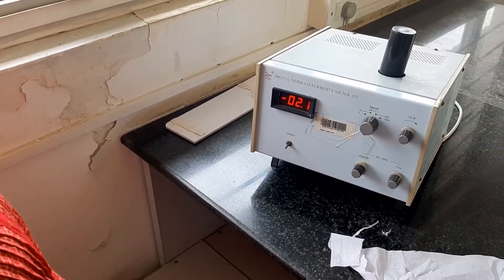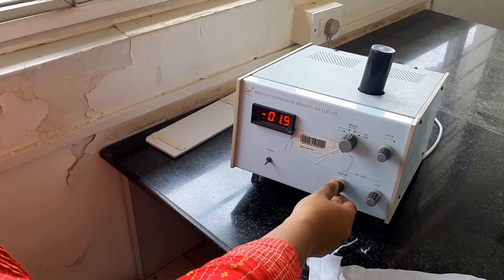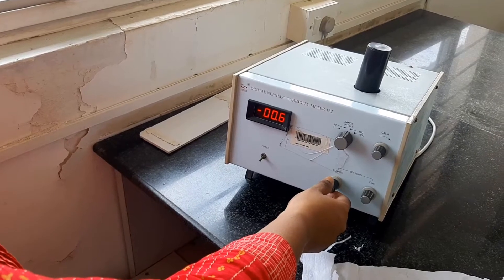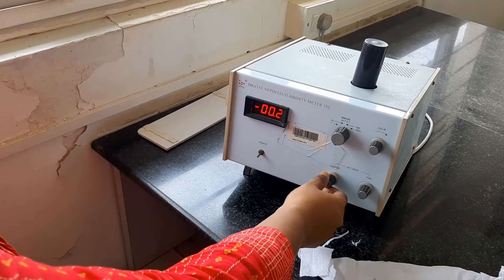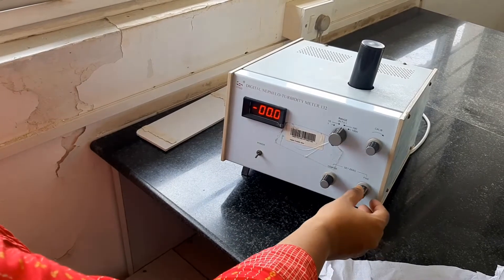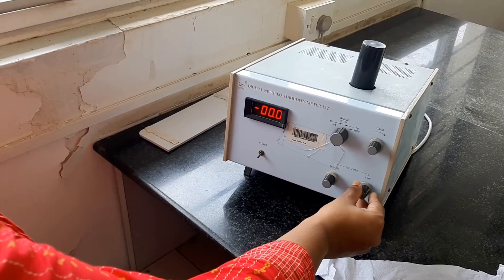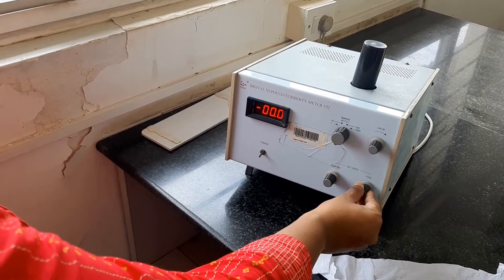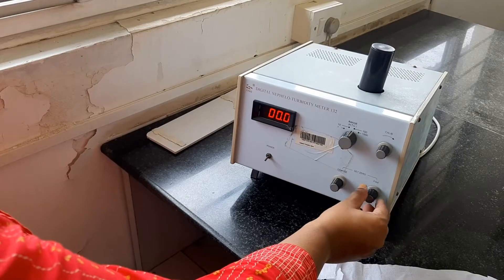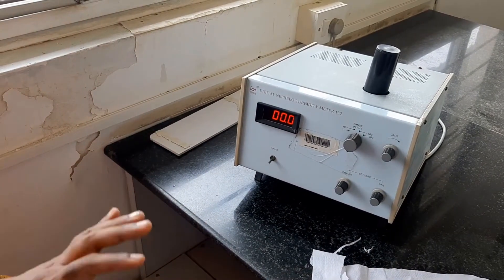So we are getting a value. I will adjust it — I have to make it to 0. I am using the fine tune control. It is no longer negative. So this has been set to 0. This is the first calibration.